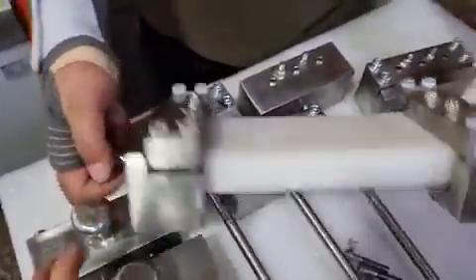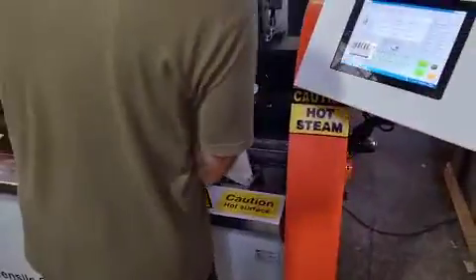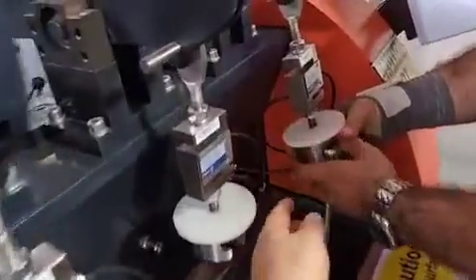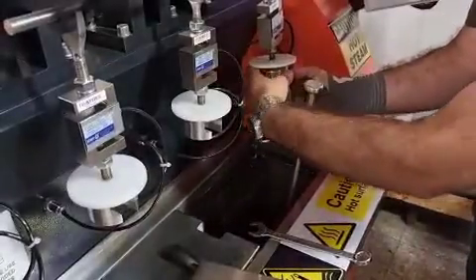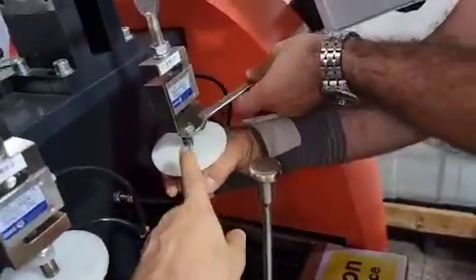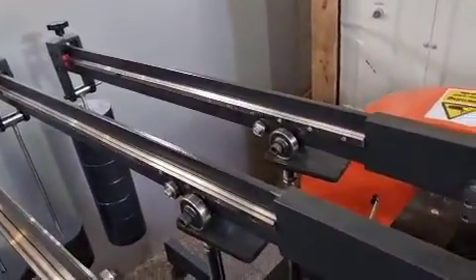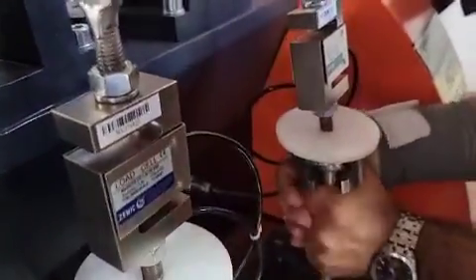The sample will be assembled like this. You can adjust the height using the screws of the gripper — there are two screws to adjust the height. One is below, just underneath the load cell, and the other is on the upper side. You can adjust the height of the gripper so that when the load is in the upper position — as you can see with station number six — it can easily go inside the gripper.